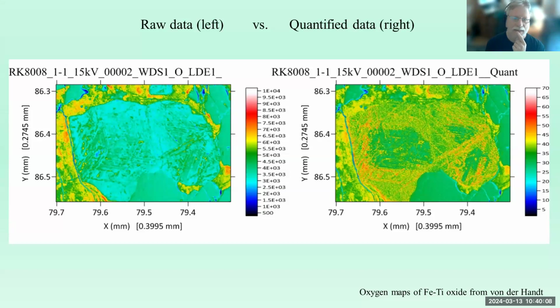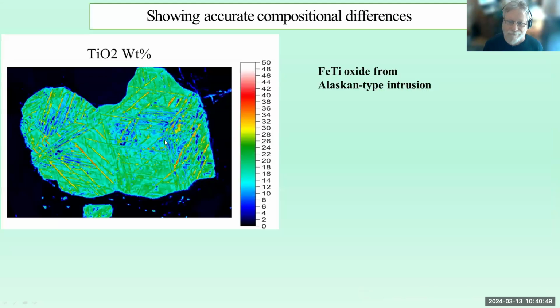Here's an example from Annette, looking at, I think, an iron titanium oxide, and here she's looking at oxygen, which of course is an element that is somewhat problematic to quantify, but it can be quantified. And this summer we'll all go to a conference and learn about how to quantify light elements. But here's an example of a raw data map of oxygen on this sample. And you think, oh yeah, look where the oxygen is, and you would be forgiven for thinking that might be the case until you quantify it. And then you look at the quantified map and you realize, oh my gosh, it's completely different than what I thought. So it is very easy to be misled.